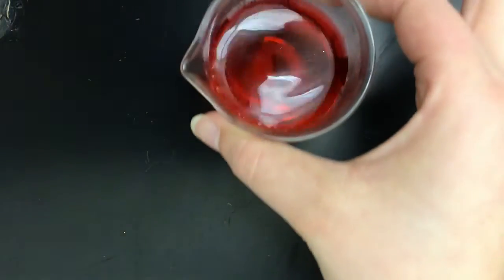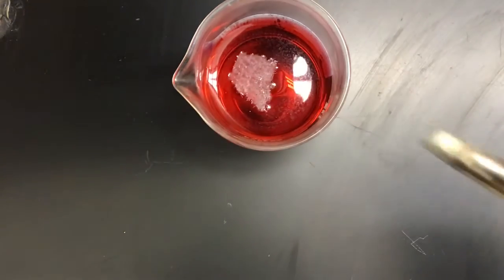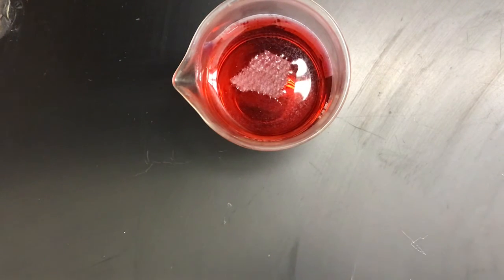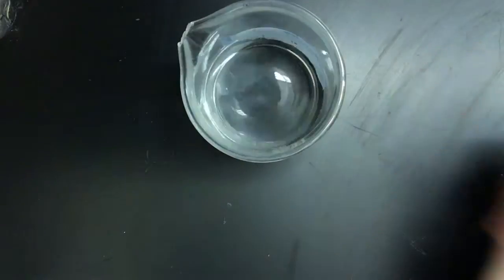So we will do water first. Here is my water. It's red to help. I'm going to take a pair of tongs and a paper towel, and I want to just set it there. So make observations about what you notice going on with our paper towel and why you think this is happening. Now we will do our hexane, and my hexane is clear.